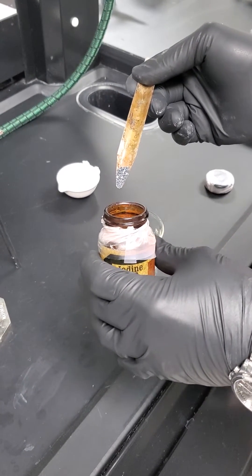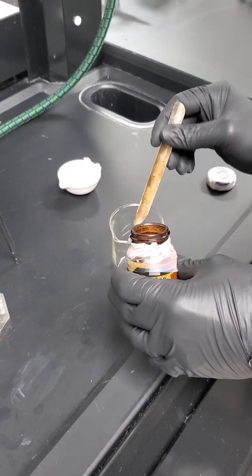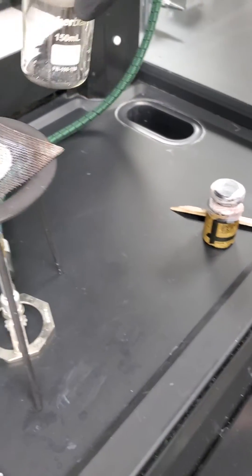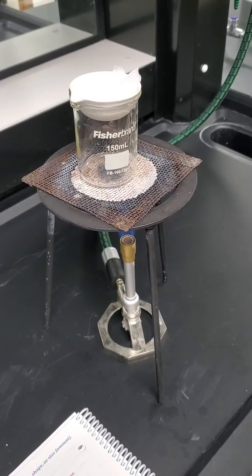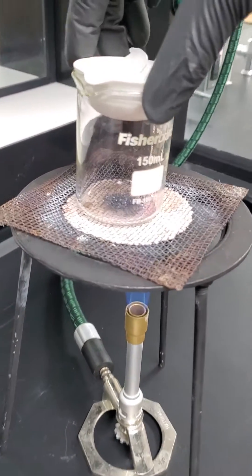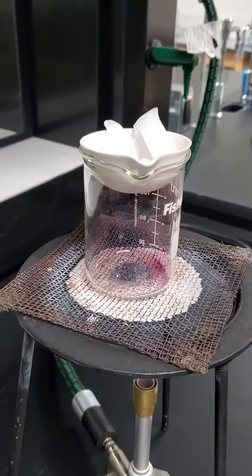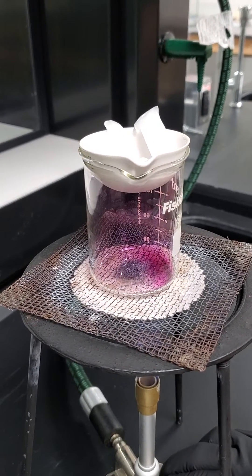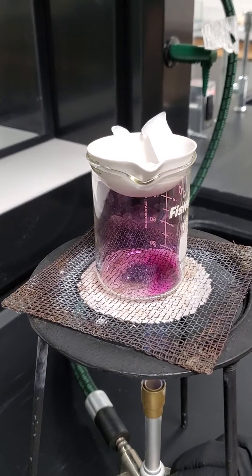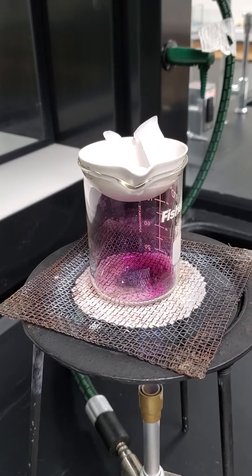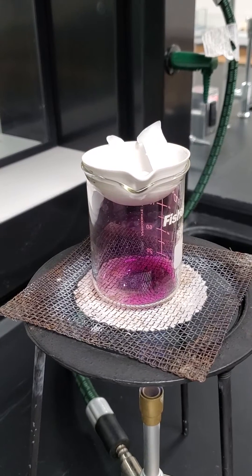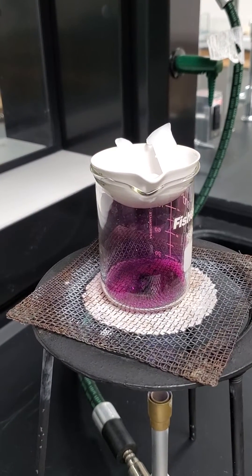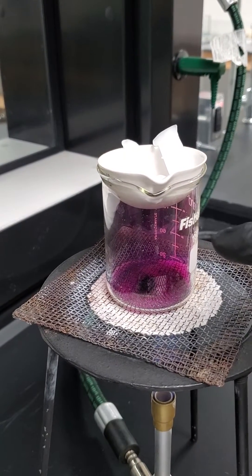So I'm going to go ahead and add some iodine and get back to you. Alright, here's our iodine. Notice it looks like glitter. Very toxic glitter though. So I'm going to put this in the beaker. Going to place our lid on top full of ice. Perfect fit. And then let it cook. So notice, nothing happens yet. But as we zoom in and start to look at those crystals that are now getting much warmer, we're going to start to see some color changes. So notice that deep kind of purple magenta color starting to form. So as you look at your observations, we definitely saw that gray glitter at first. But now we see that nice deep purple kind of color starting to form. This process here is sublimation. Notice we don't see any liquid iodine. We only see that solid turning into a vapor in the middle of that beaker.